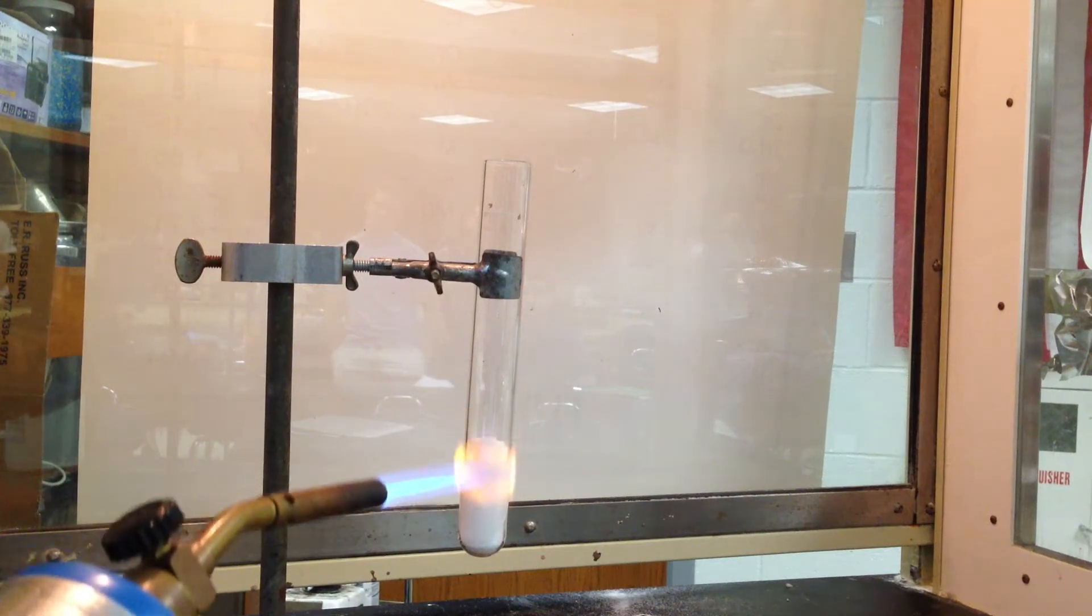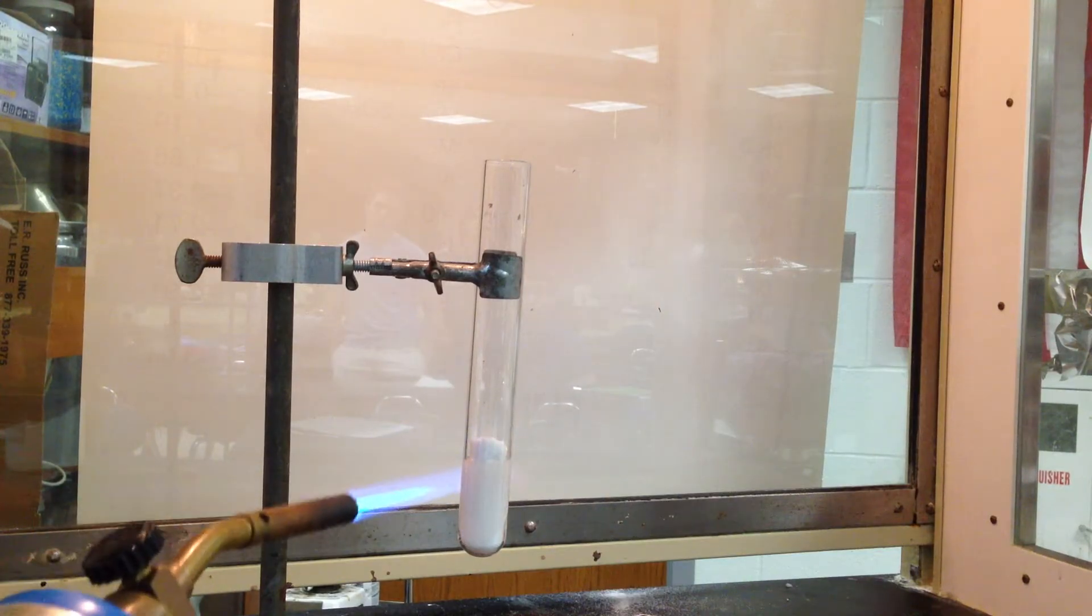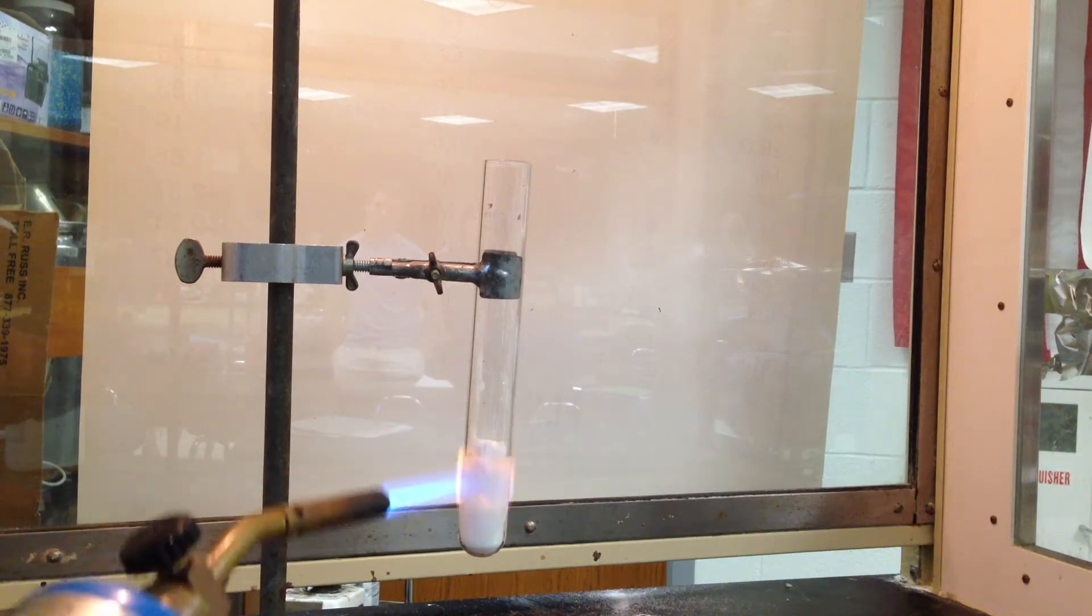So if I was to light a match above this tube, and I don't think I have a match here, I could probably show that.